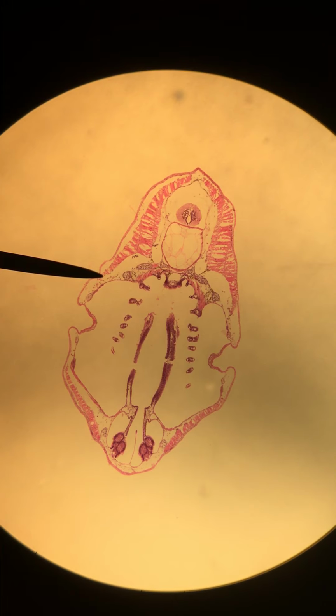I have the cross sections now of our Ammocoetes. Unfortunately, this is the most rostral slice that I could find in all of the slides that I brought home. So it is not quite as far towards the head as figure 18 in your lab manual. I need to refer you to that to see the brain, the eye, and the carotid artery. Make sure you take a look at that figure.